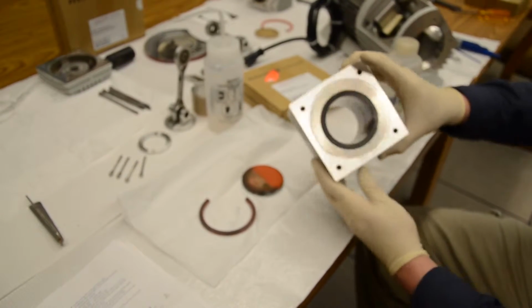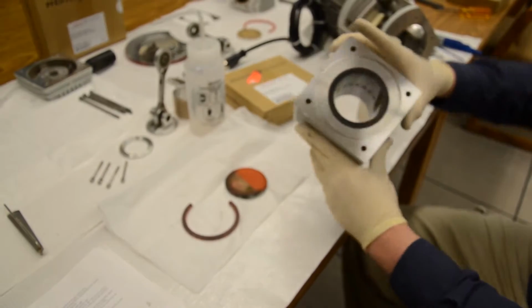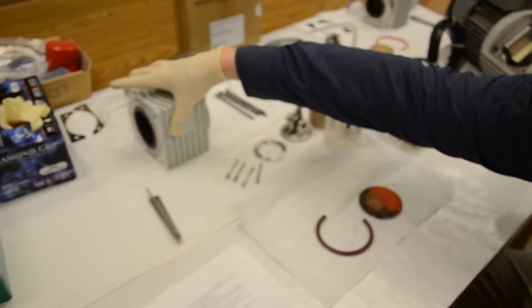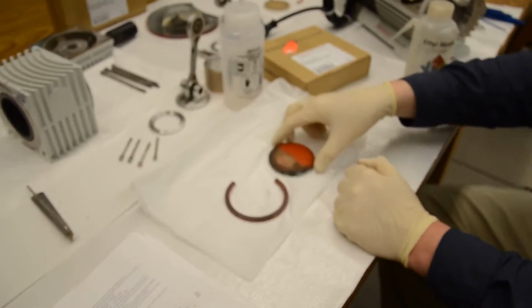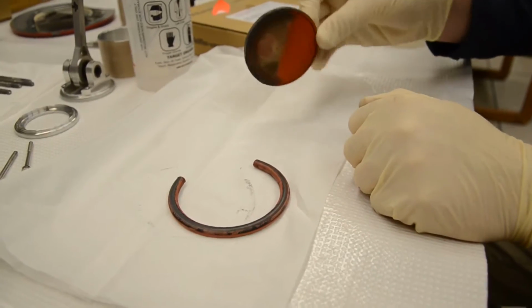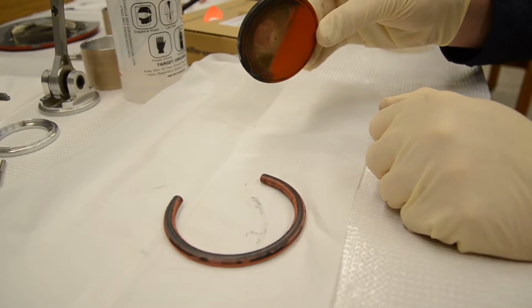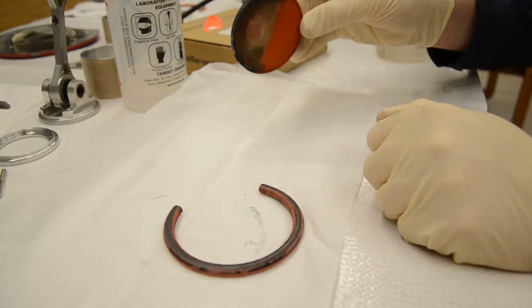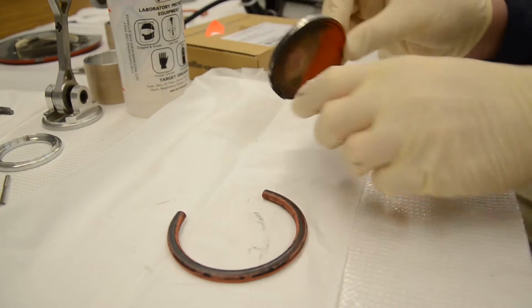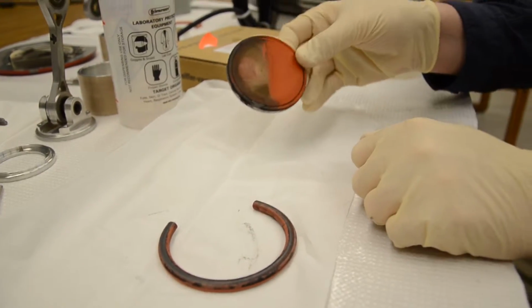Alright, so as you can see, we have cleaned this block. It's in pretty good shape now, so we're going to set that aside. And now we're going to go to this right here, which is actually the atmospheric gate, or the atmospheric valve. So this is what actually sits on top of the piston. It's on the opposite side. The piston moves up and down kind of against this valve.